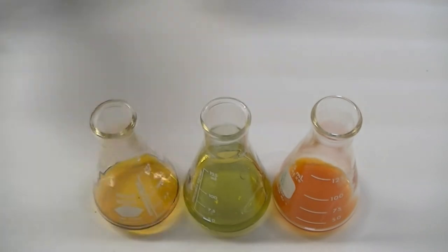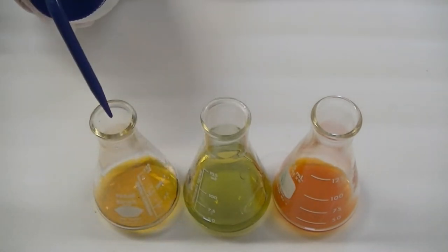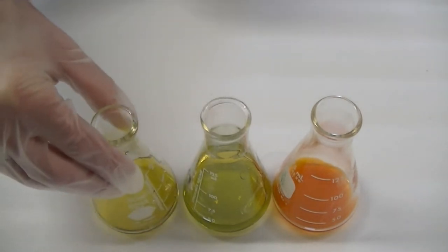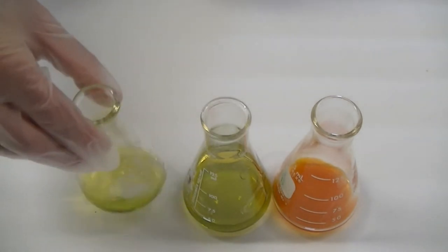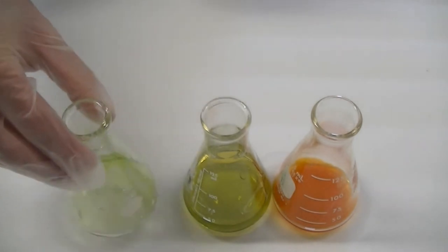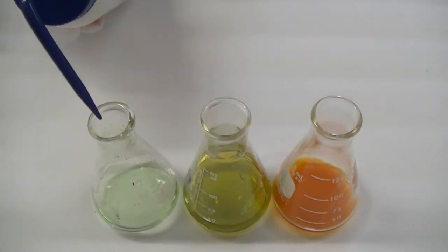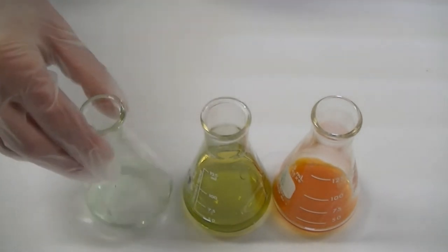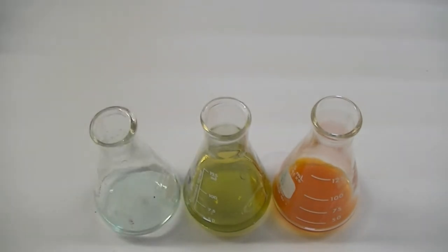Well, there's a shift to yellow. Now it looks kind of yellow-green. It looks sort of green now. Hey, it looks like it disappeared. But you know, if I look really closely, I see a faint blue color.